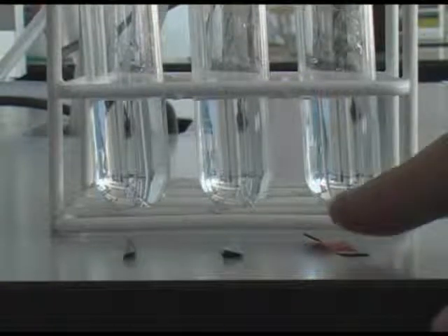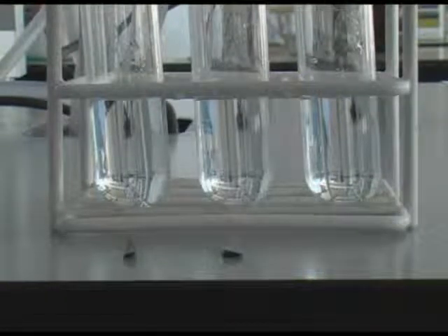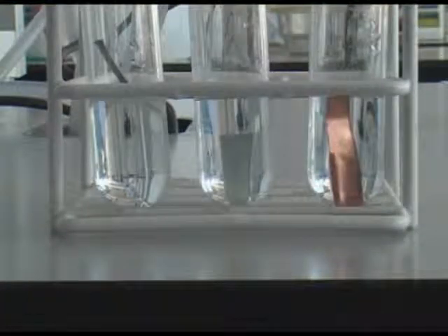When we place these metals into sulphuric acid, we can observe the reaction which takes place. In the case of magnesium, you can see that production of gas begins immediately in a vigorous reaction. If we take a look at the zinc, you can see that bubbles of gas have formed on the surface, but the reaction is quite slow.